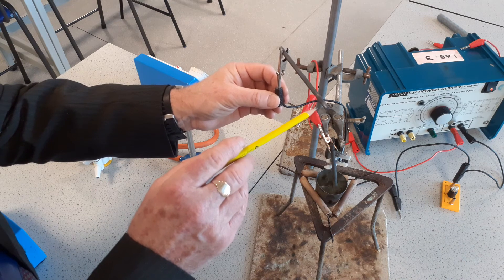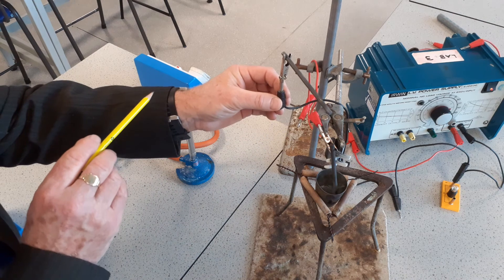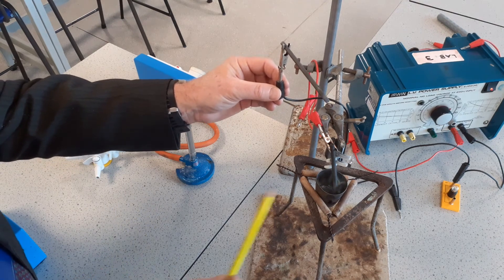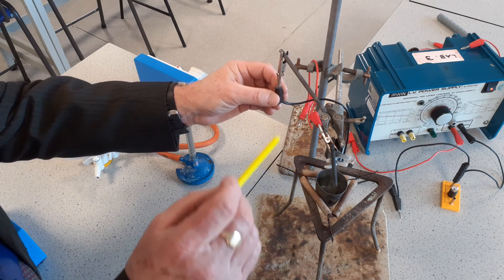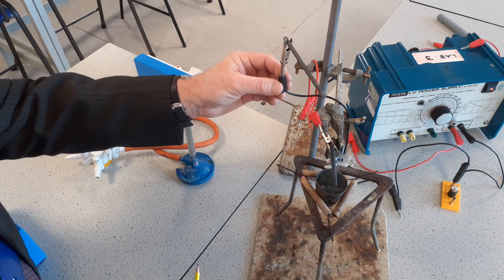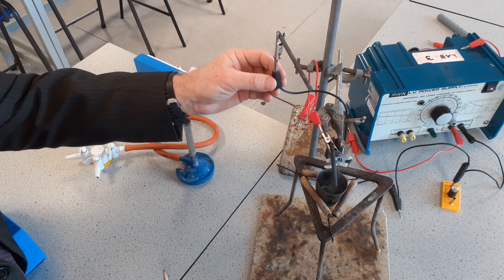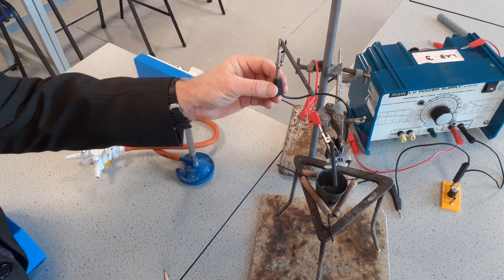If you look at the cathode here, it's got a grey tinge at the bottom because that is where lead is formed in this electrolysis. So let me remind you of the products: we've got molten lead bromide, and when we electrolyse it, we get lead formed at the cathode and brown fumes of bromine at the anode. In molten electrolysis, there are only ever two products — the metal formed at the cathode and the non-metal formed at the anode.